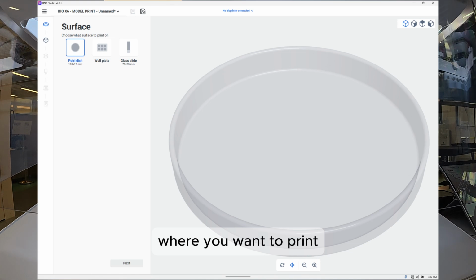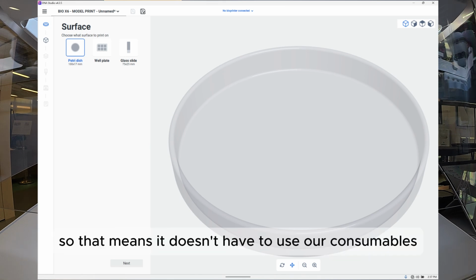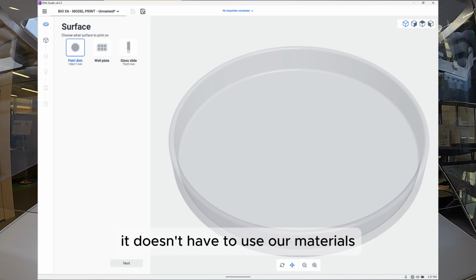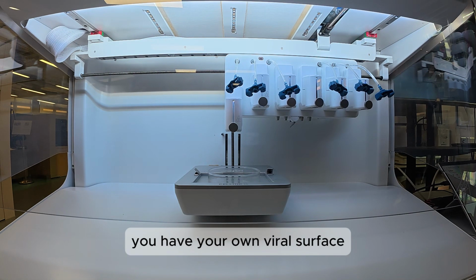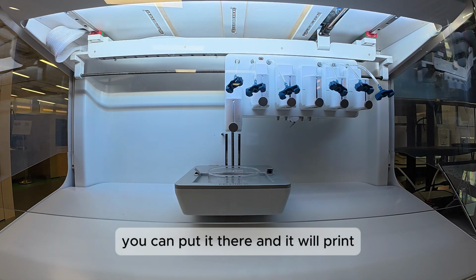For BioX, one thing I didn't mention just now is that this is an open system. That means it doesn't have to use our consumables or our material. You have your own material, you have your own surface, you can put it there, and it will print.